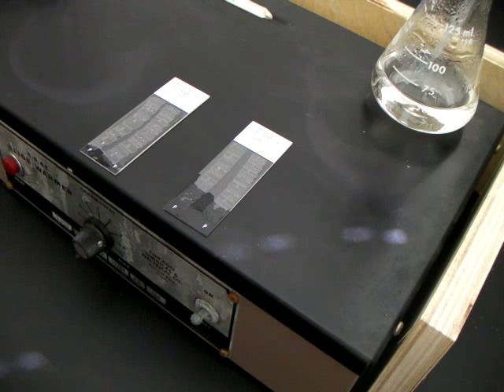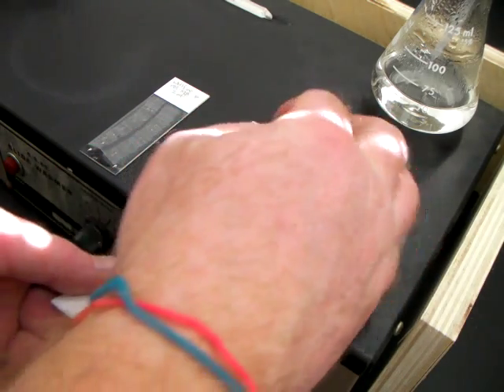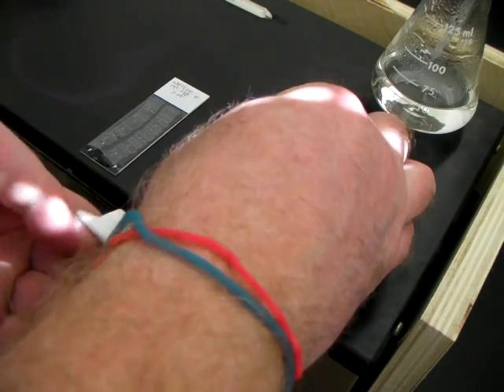If the chem wipe and the ribbon touch each other, then chances are good the ribbon's going to stick to the chem wipe, and then you'll be SOL for a good slide.